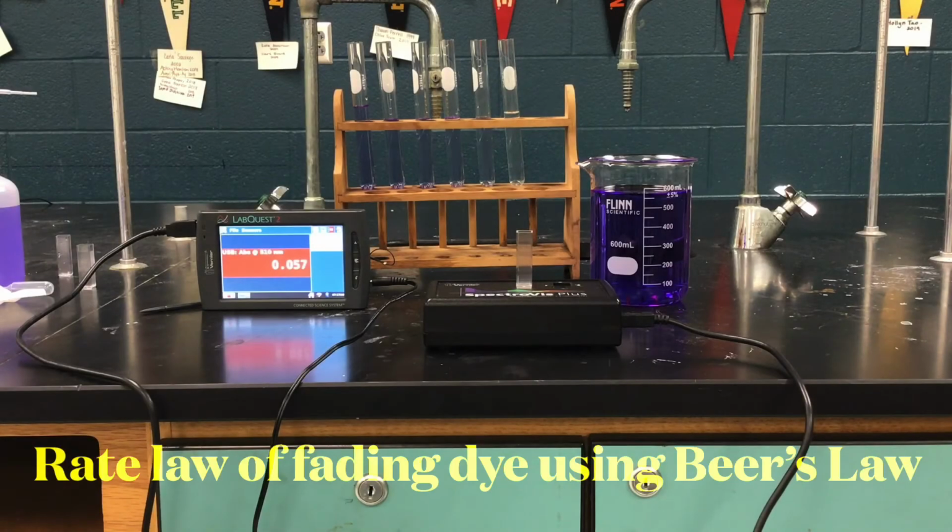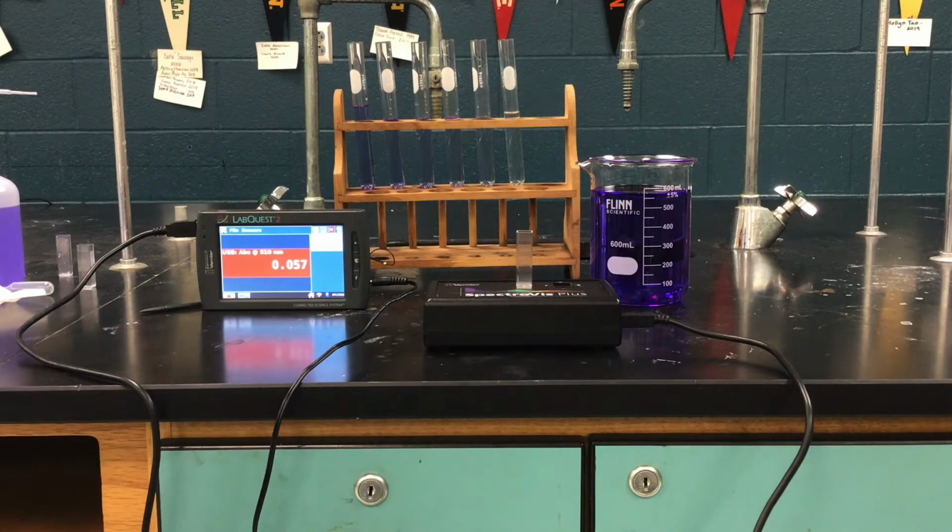Today we're going to look at the rate law of the fading dye using Beer's law. I have set up the lab already for us, and you'll see that I have a LabQuest with a spectrometer attached to it.